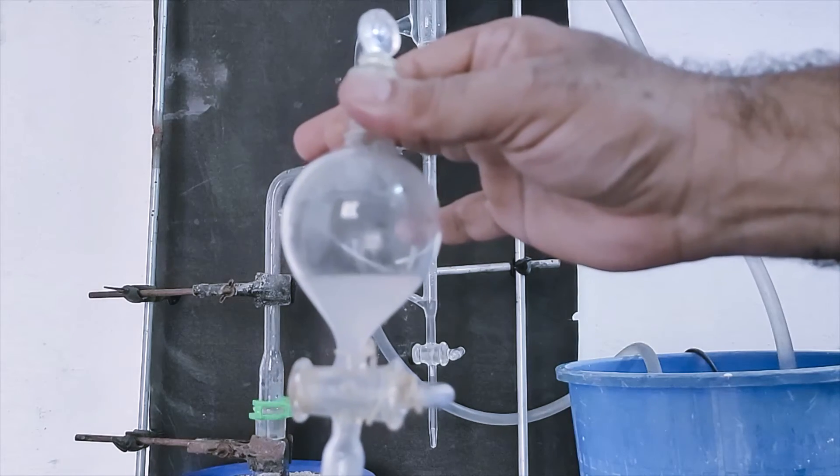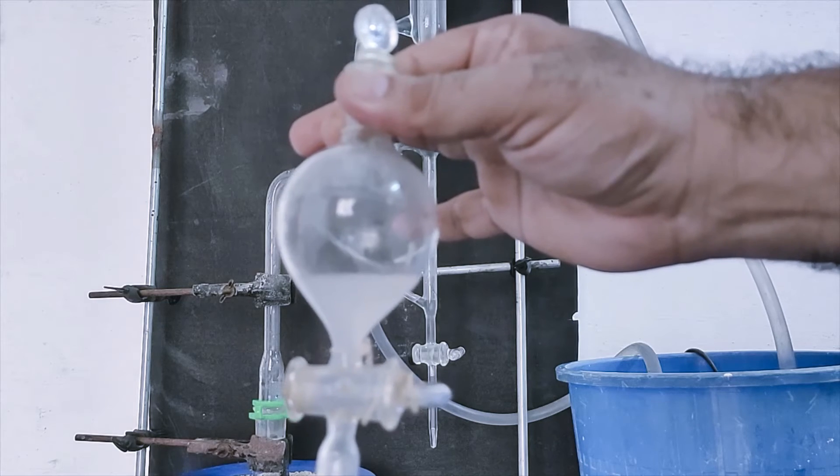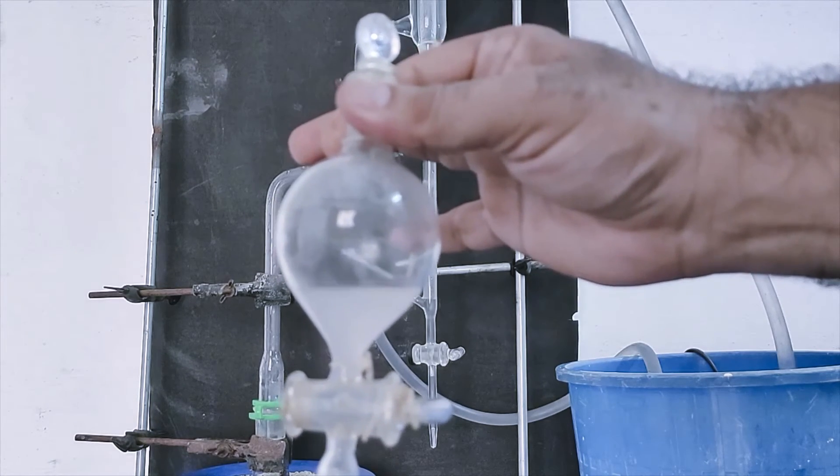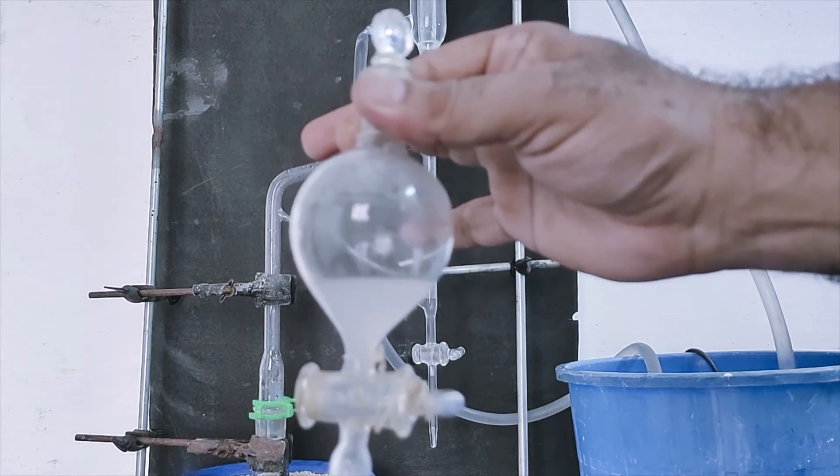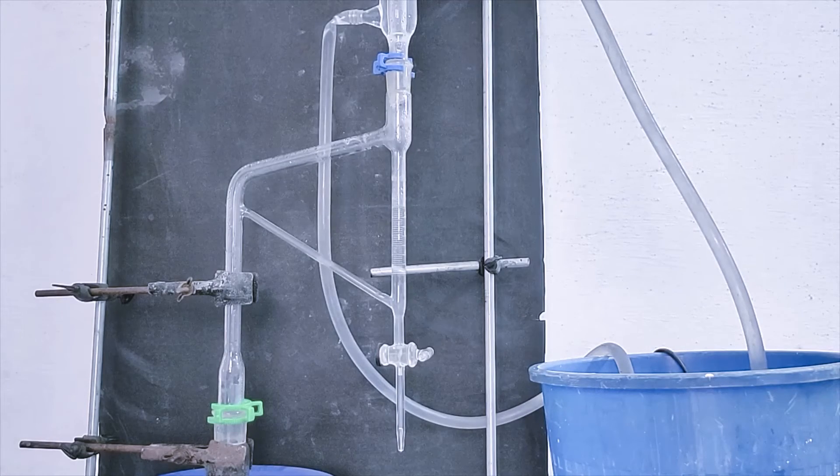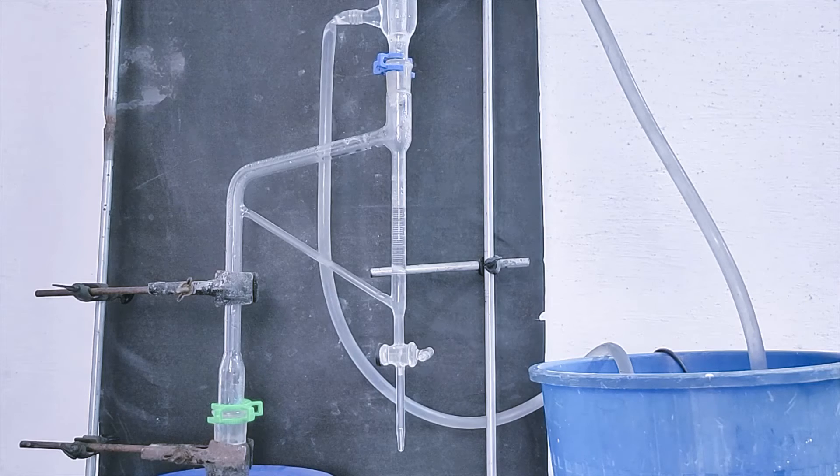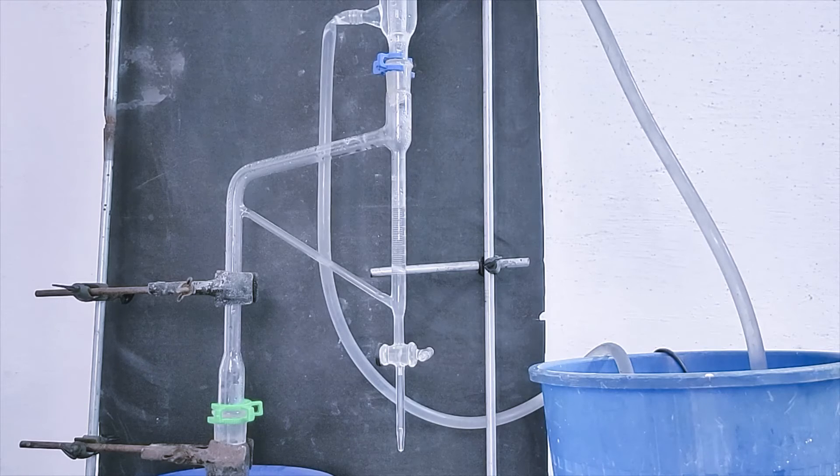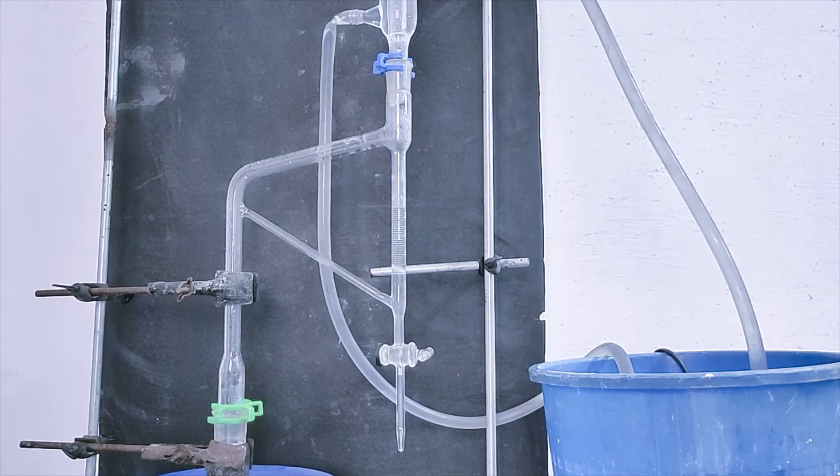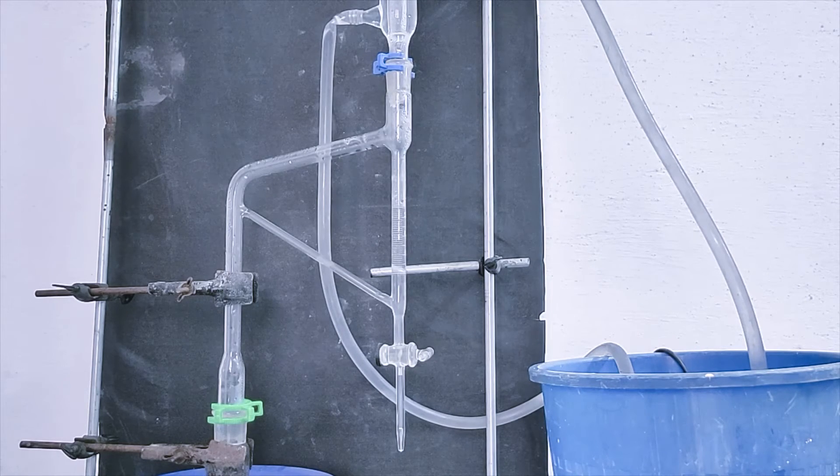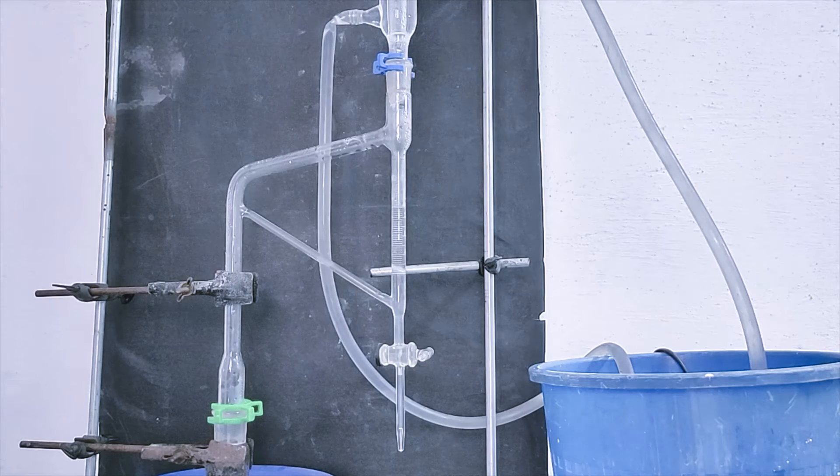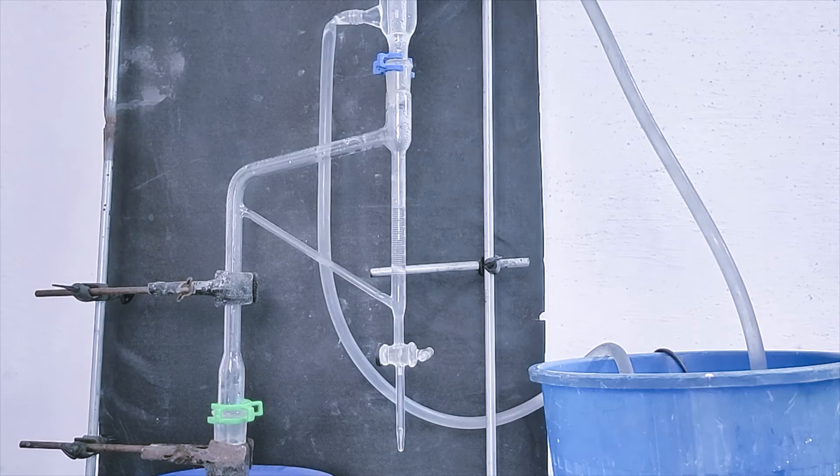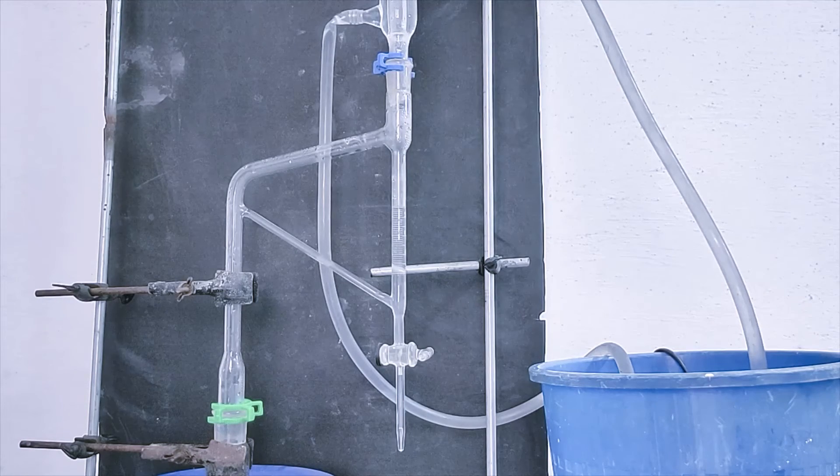Essential oil in the emulsion form, present in mint, menthol. First fraction I have collected in a separating funnel. Now second fraction is also completed and if I am satisfied with this fraction, I can mix it up with first fraction. I am collecting it in a beaker.